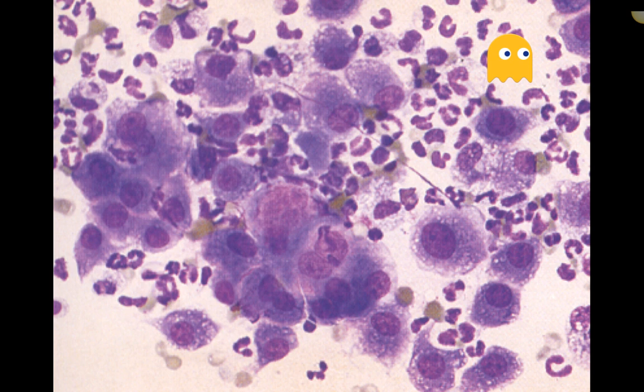So this is one of my fave samples. This is a good pyogranulomatous inflammation. We've got heaps of macrophages and then heaps of neutrophils as well. And you can see again, if you remember me doing that weird body position whereby I'm representing the nucleus going toward the end of the cytoplasm, I'm even doing it now at my computer and you can't see me, which is kind of weird. So lots of degeneration of the neutrophils here. They're not looking like they're doing a good job battling. Okay, small things to point out so that we can come back to them later.